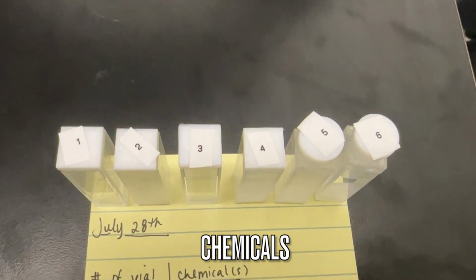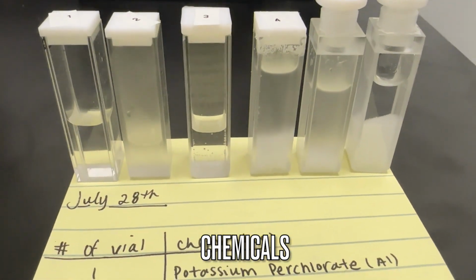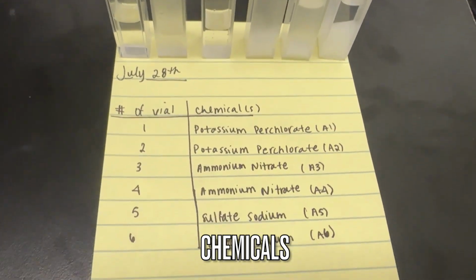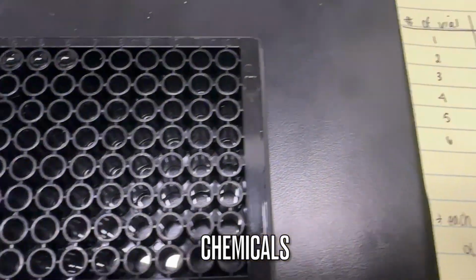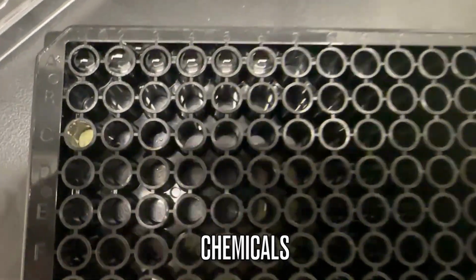So in this video we have 6 different chemicals. 1 and 2 are the same chemicals, 3 and 4 are the same chemicals, and 5 and 6 are the same chemicals. The only reason that they are different is because they have different concentrations in them. So now we're moving to the plate that we'll be putting inside the well plate reader.